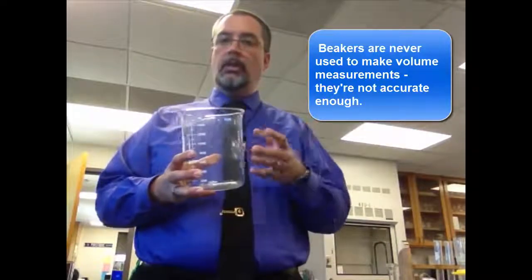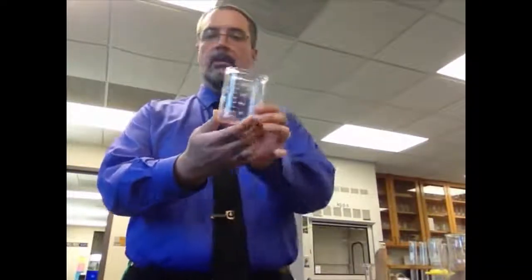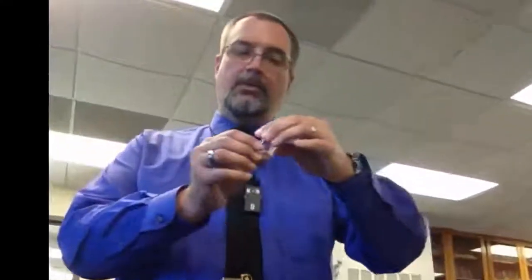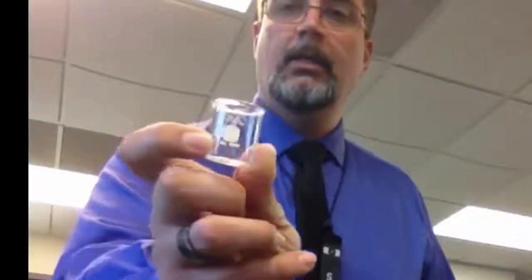So you might put a liquid in here. If you wanted to boil some water, for example, quite a bit of water, you would put it in here. Beakers come in various sizes. This is probably one of the most common sizes. This is a 250 milliliter beaker, and again you'll see it's got numbers on the side, but we don't use those numbers for anything. And then they go very large, and they even get down to very, very small. This is a tiny little 10 milliliter beaker. And isn't it cute? It's cute. So a beaker has straight parallel sides. It may or may not have numbering on it. It's just used to hold stuff.